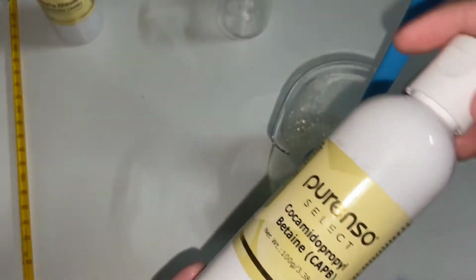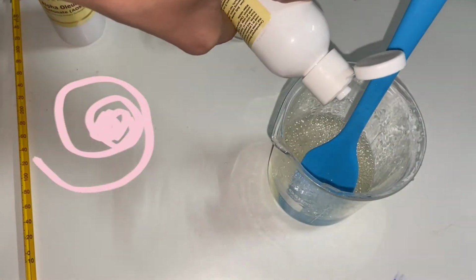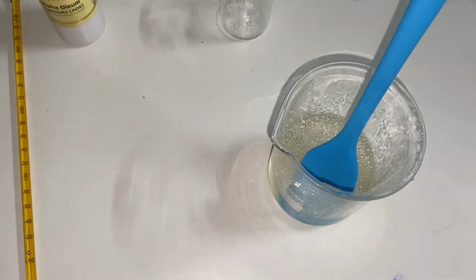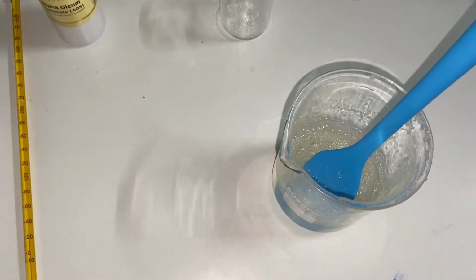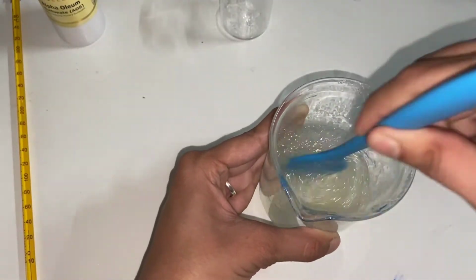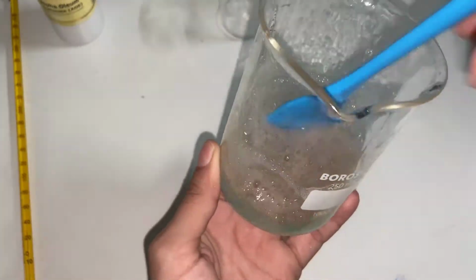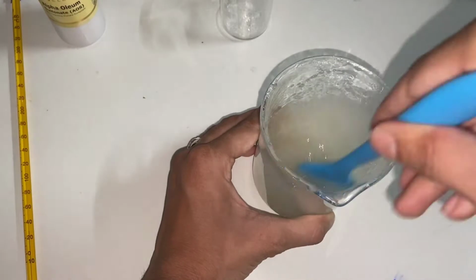After this, add CAPB into it. CAPB is cocoamidopropyl betaine. It's a secondary surfactant. As it is a secondary surfactant, it is a foaming agent. It will give us the cleansing property, but not in that way. You can see here, as I add CAPB into the beaker, the slurry becomes thick. See, you can see here. The reason is that if we combine CAPB and CDEA, it will provide a slight thickness to the product.